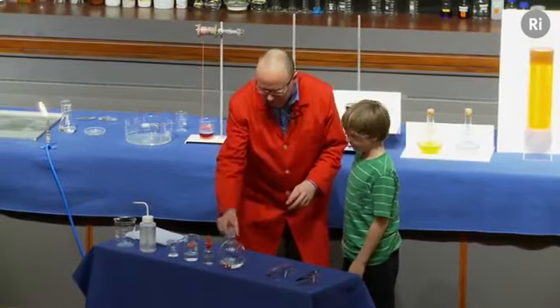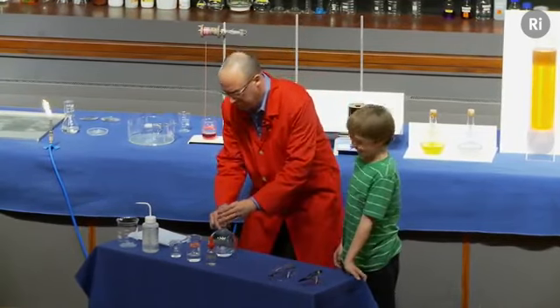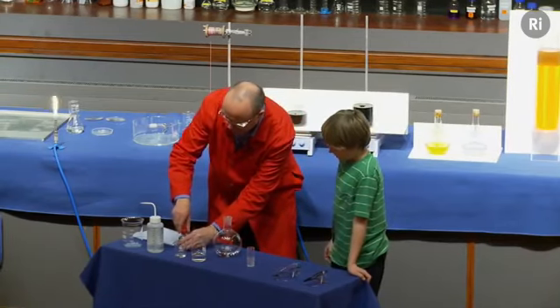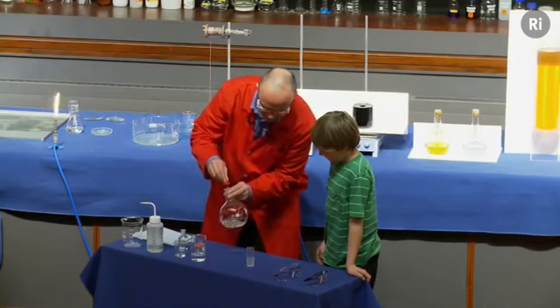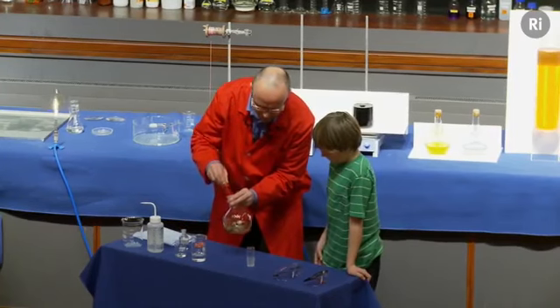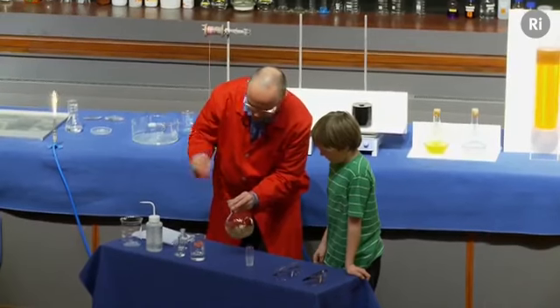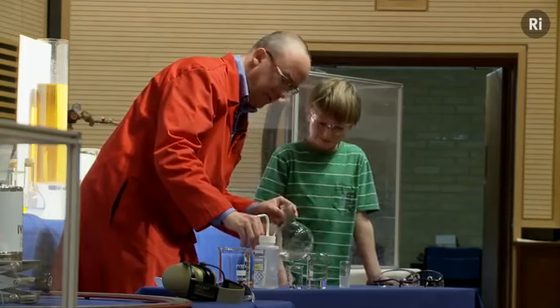All right, Dylan, if you stand just there, we're going to do some chemistry and we're going to make a solid. I'm going to start off with a flask that contains a solution of silver nitrate, and I'm going to add a little bit of ammonia. Now when I add the ammonia, you see that it's forming a sort of brown colour. I'm going to keep on adding the ammonia, and in a minute that brown colour should disappear. There we are, it's disappeared, isn't it?